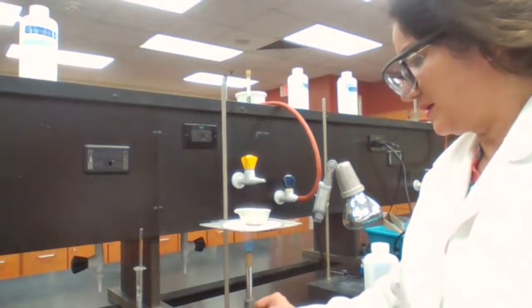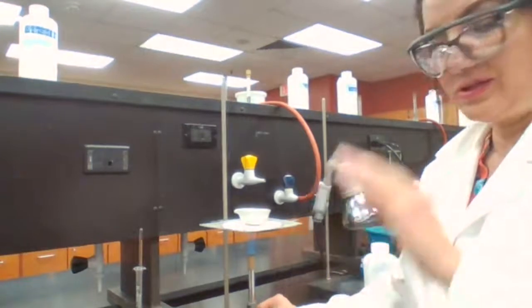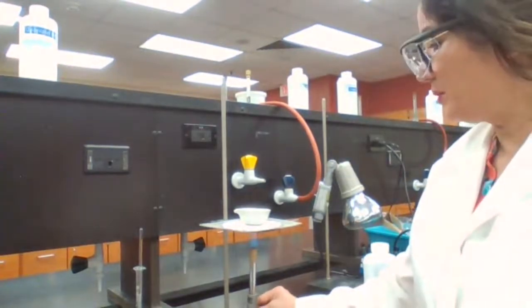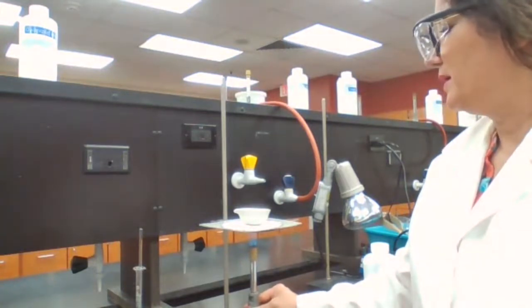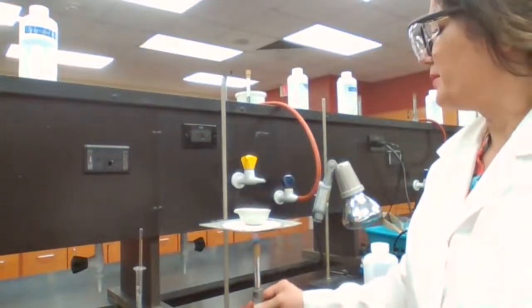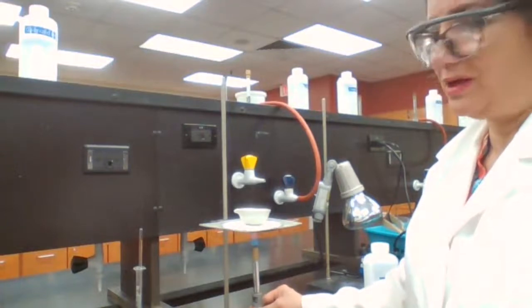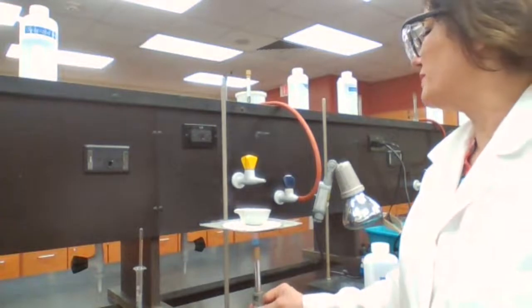So if you adjust the container or where you're heating to the level that it touches the top of the inner cone, you are providing the highest temperature of the flame. And if you want a cooler flame, you have to make it more distant. Definitely no yellow flame, because a yellow flame has low temperature and is not a safe flame to work with.